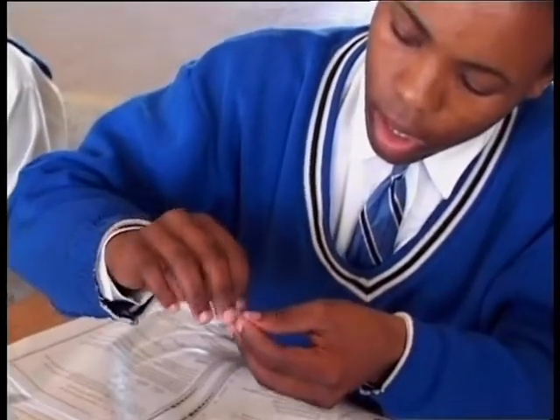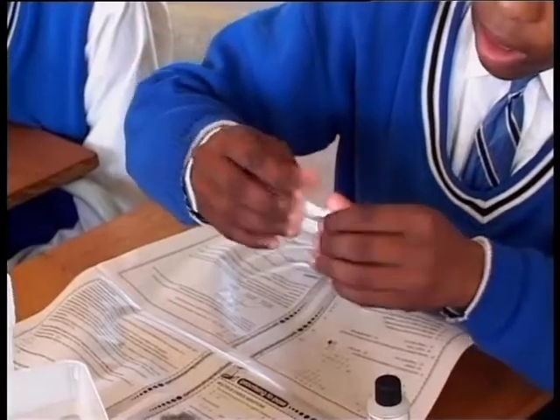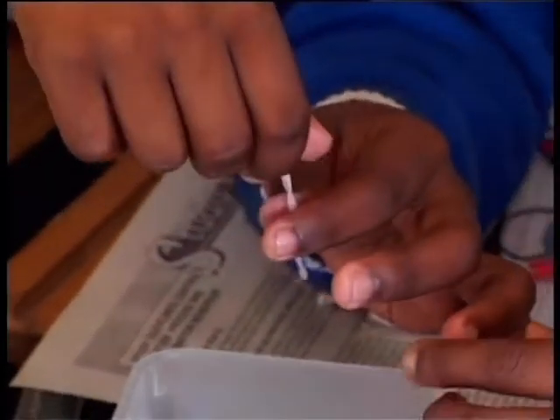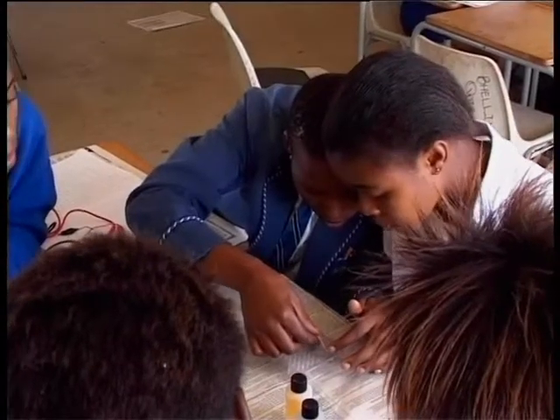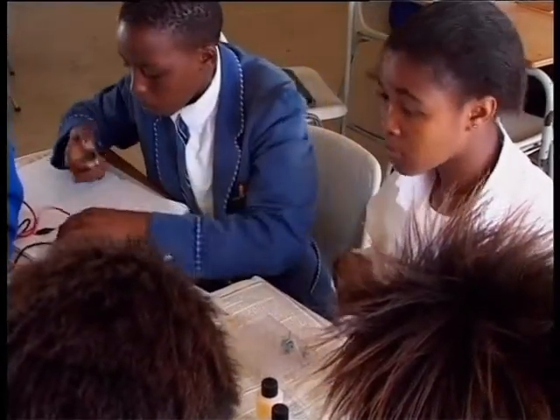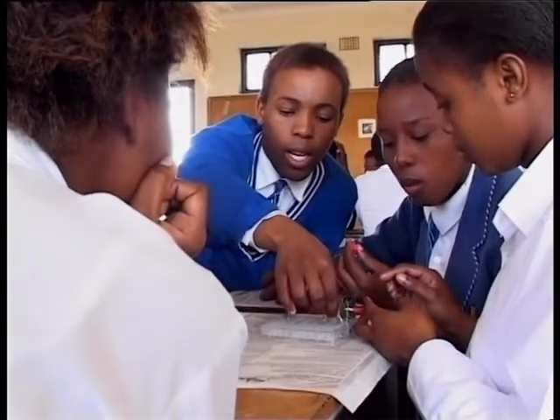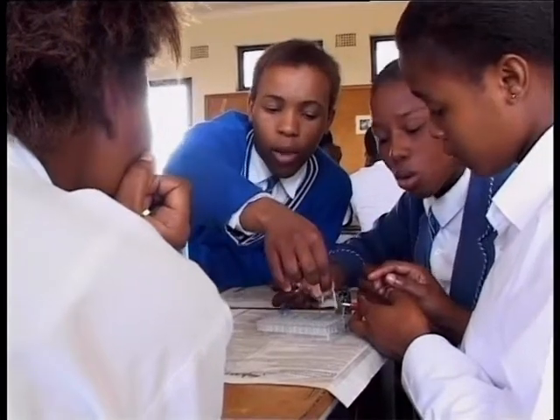In the first experiment of the circus, the learners are investigating a zinc copper cell. Learners insert a salt bridge made from tissue into the prepared solutions and connect the voltmeter. The purpose of the experiment is to observe the spontaneous generation of electricity when there's a difference in potential between 2 metals and their salt solutions, even when they're in separate containers. The learners will determine which metal is oxidized and which is reduced by observing changes at the cathode and anode.